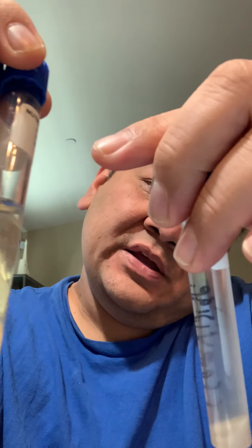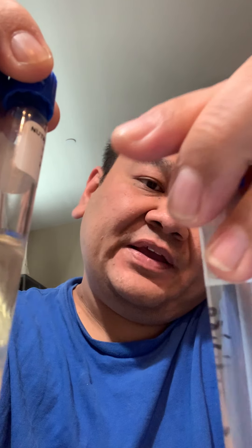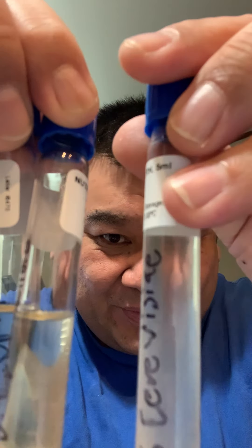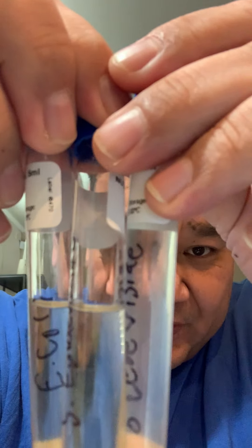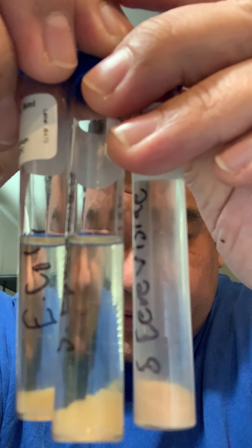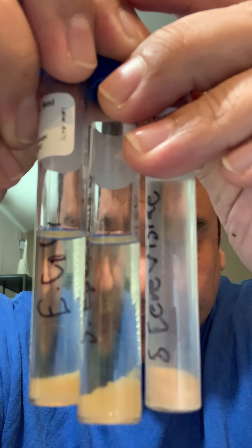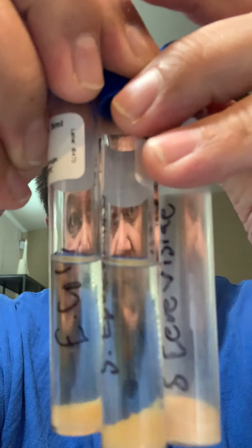And the last one — I don't know how to pronounce it — the liquid is kind of cloudy compared to the last two, but the salt stayed on the bottom.